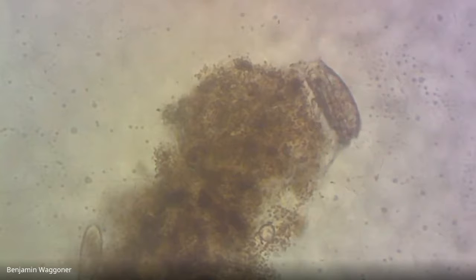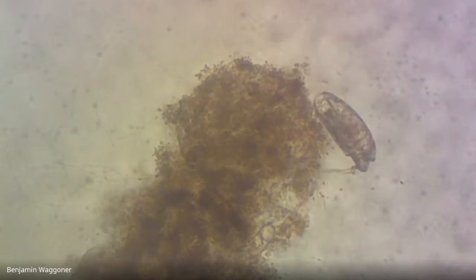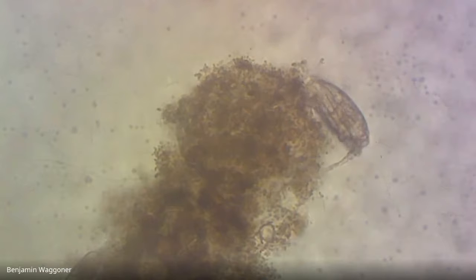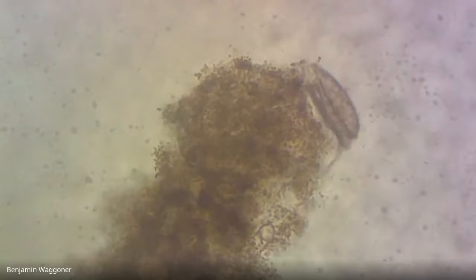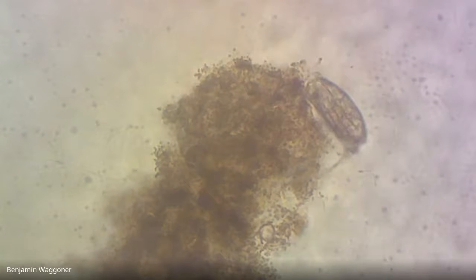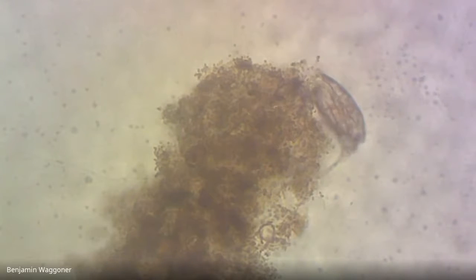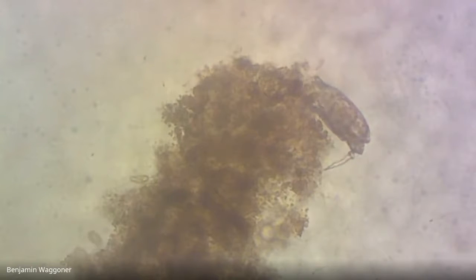It's called a rotifer. We're going to do a later lab that's going to involve getting up close and personal with an awful lot of rotifers. They're about ciliate size, and they tend to live in the same niche. The way you can tell these apart is many of them will have that kind of jointed appearance to them. Ciliates don't really have joints. They'll typically have a tail with 1 or 2 little toes at the end, and sometimes they're very long and sometimes they're stubby. This one's kind of long, kind of a long single pointed toe at the end.